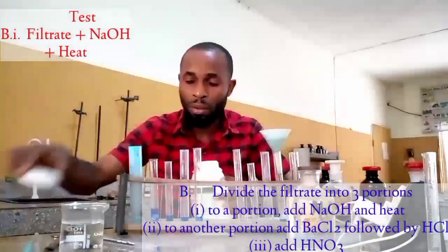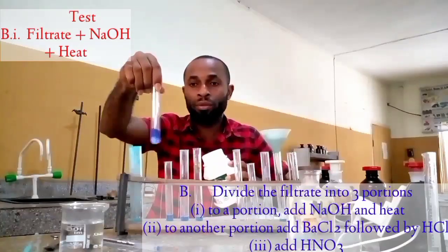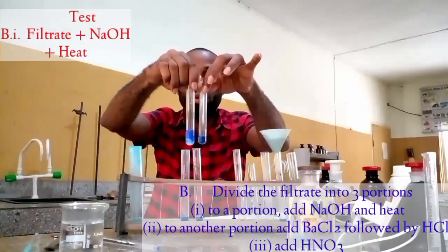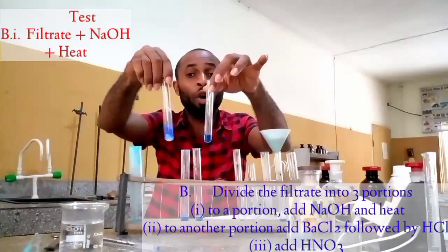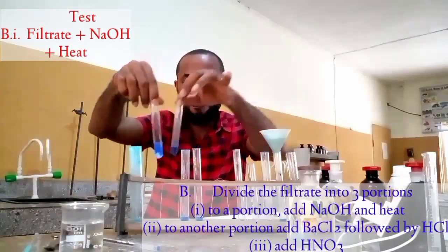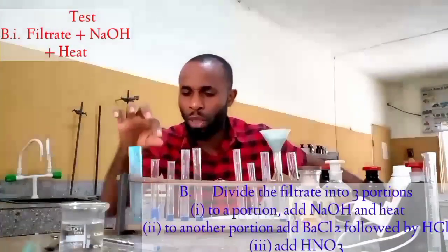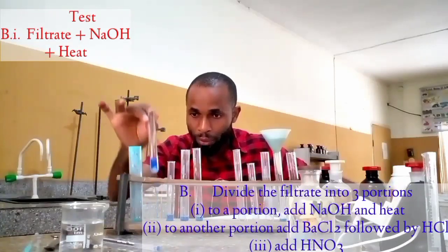Just watch. Let's see. Check the color here. You notice that the color here is deep, but this one is becoming pale. It's becoming pale. Okay. This is actually telling us something, that copper is present here, but there's still something that is going to happen here. Let's wait for this to settle.